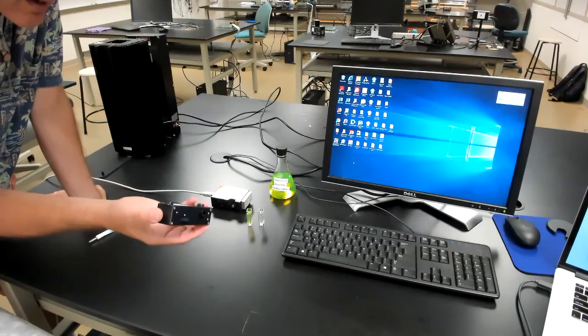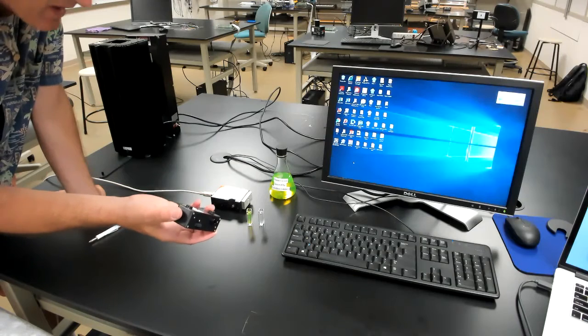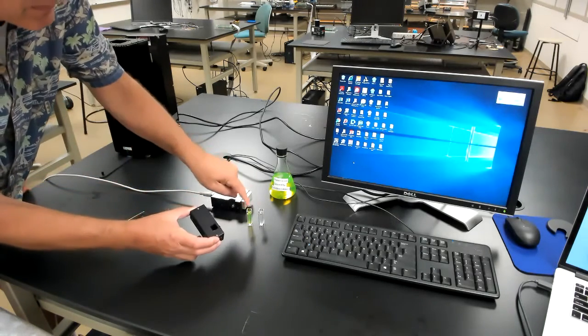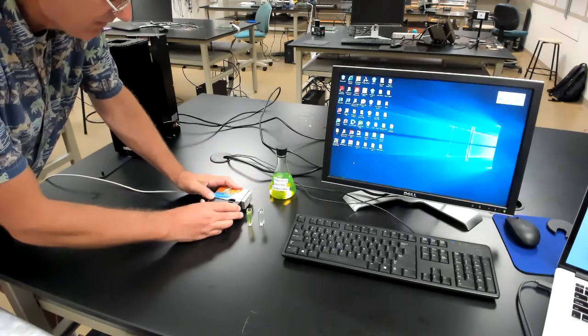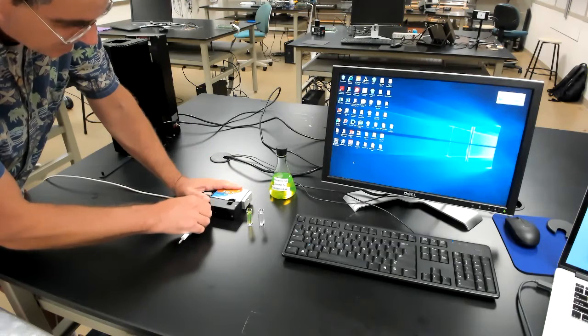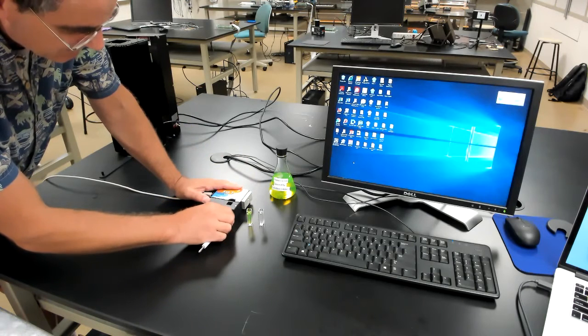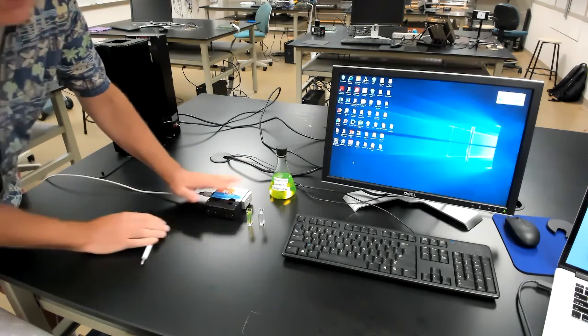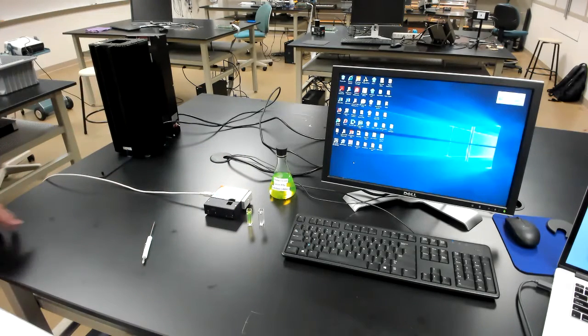To begin with, we have a transmission attachment for our spectrometers that contains a white light source and is also designed to hold these cuvettes. So let's go ahead and place that in, and I'll attach it. As simple as that for this equipment. And then we can start the program in order to take our measurements. So we'll start Logger Pro once again.